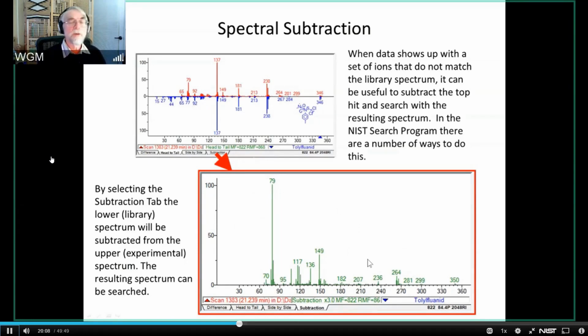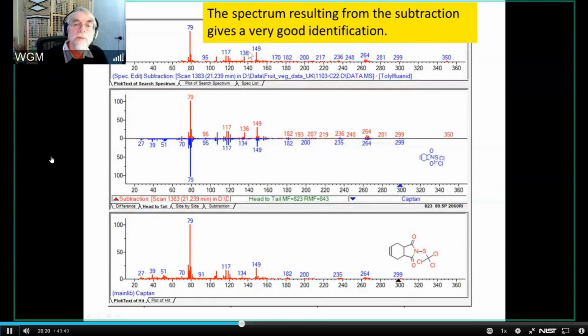And once you've got that new spectrum, you can search it. It's no different than any other spectrum. You can just simply search it within this library. And when you do that, here's that subtraction spectrum, and you see it says it's a subtraction of this scan minus this compound. So that's the spectrum that we're now searching. This is the comparison between the search spectrum and the library spectrum, and it's a very good match, 823, and a probability of 89% that it's right, and it matches CAPTAN.